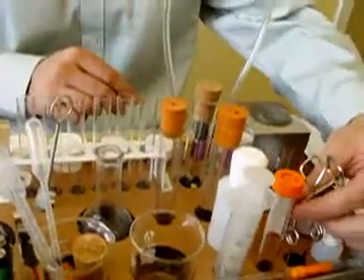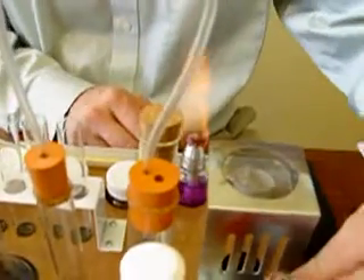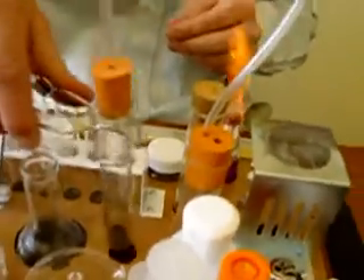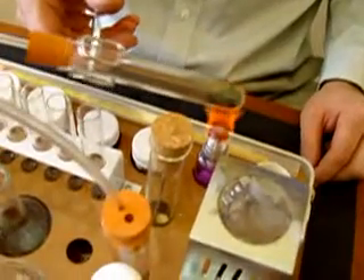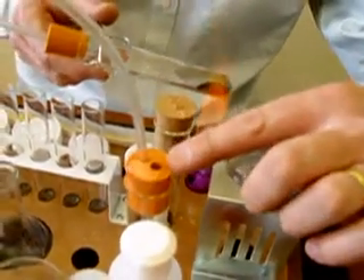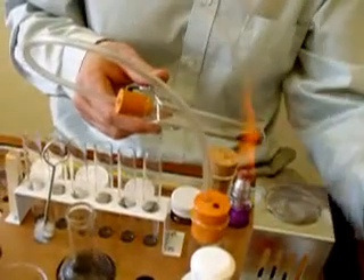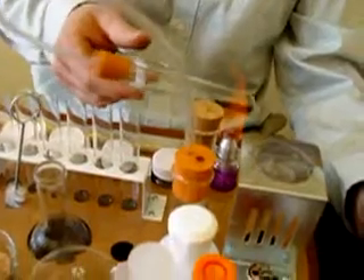Light the spirit burner and then start heating the potassium permanganate. It'll start delivering oxygen almost immediately, but I'm going to wait for a while so that it pushes the air through that was left in this test tube over here, and just let the reaction take place for a little while to make sure all the air has been pushed through.